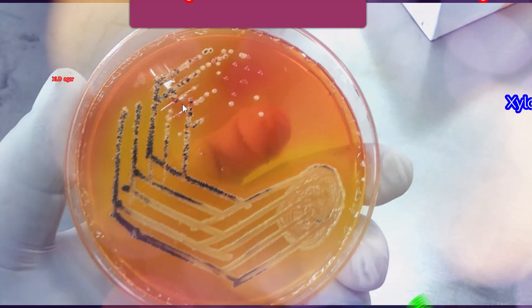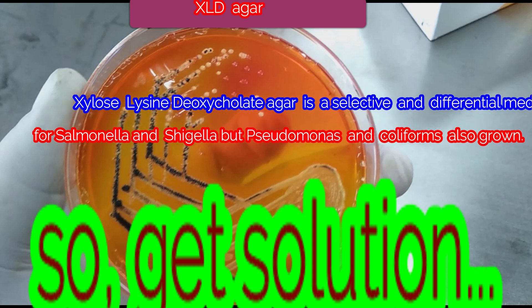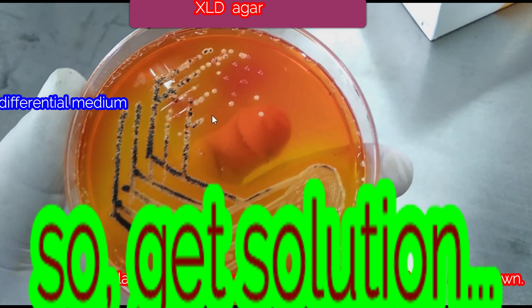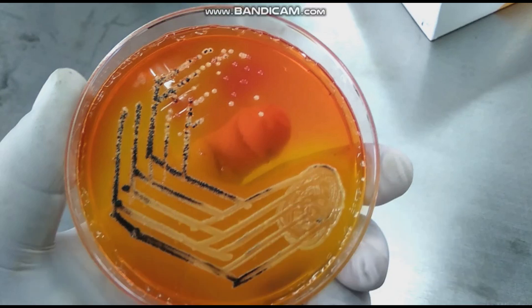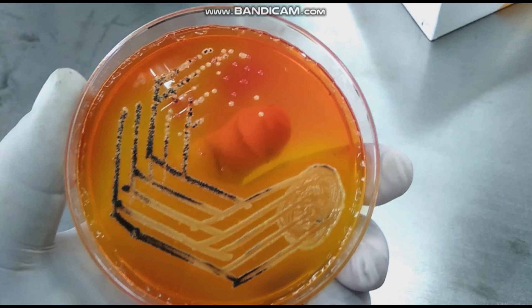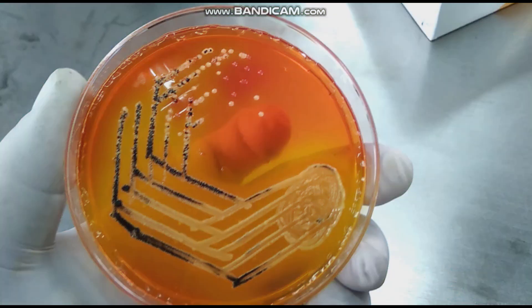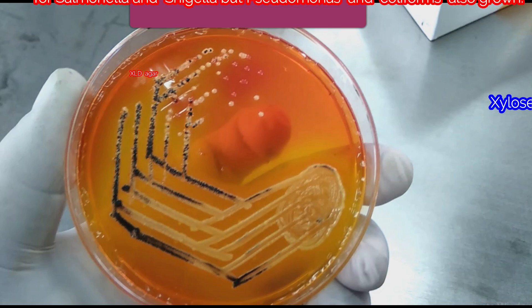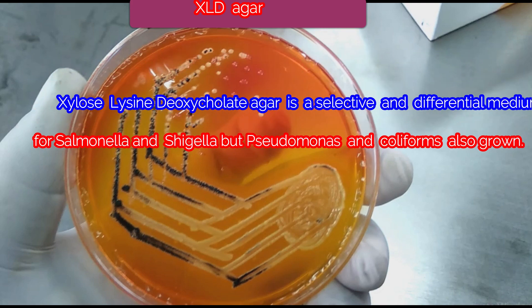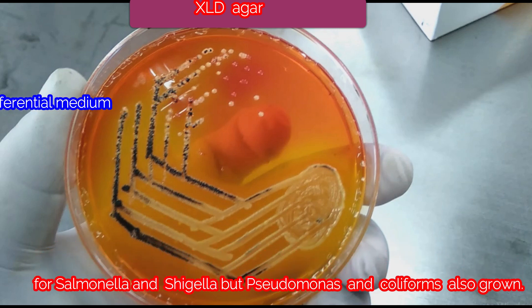Since both Salmonella and Shigella produce the same pink color, we use the H2S indicator system to differentiate them. If the organism is producing H2S, then a black precipitate of H2S gets deposited on the colonies. Thus, Salmonella gives pink colonies with a black center.